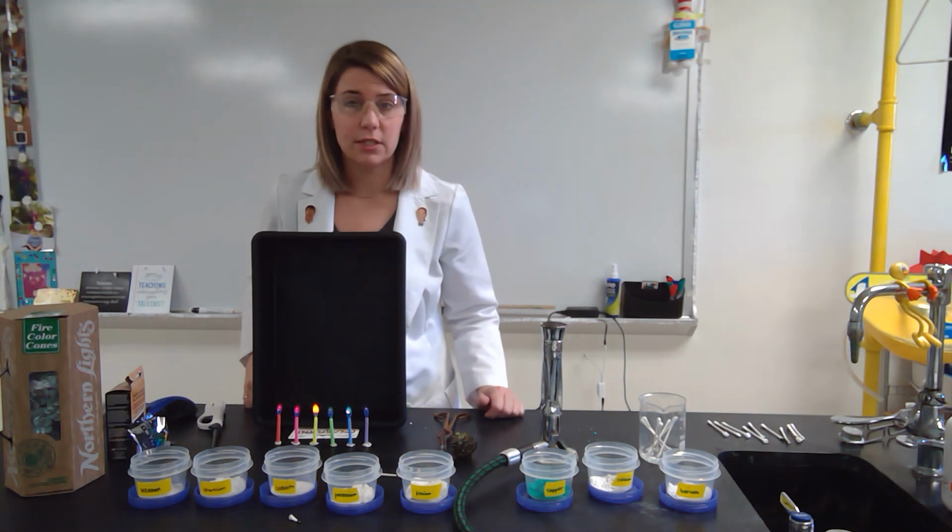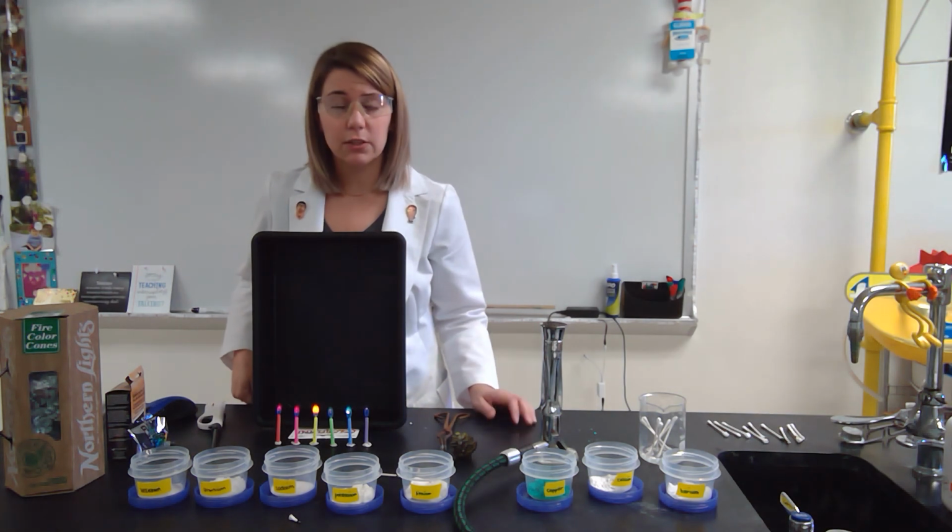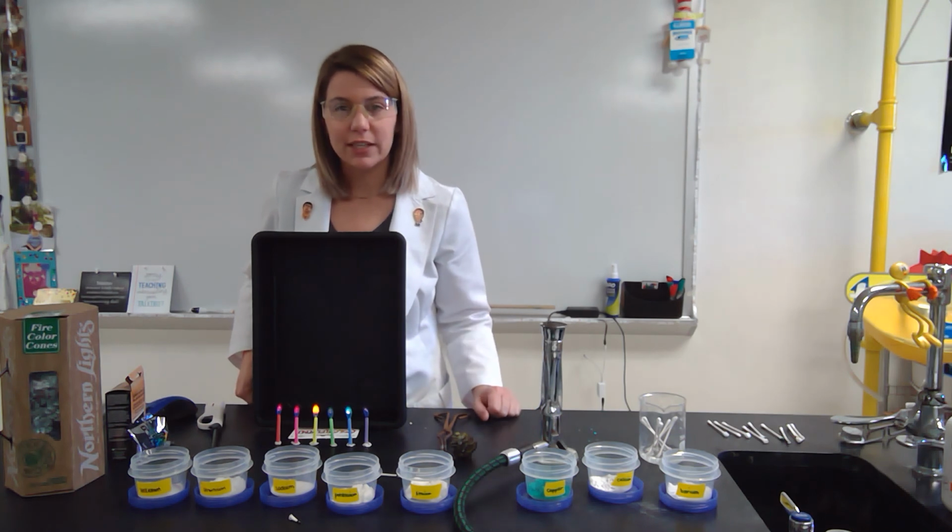So here are some applications of the Flame Test Lab, some things that maybe you've seen in real life, and I hope that you really enjoyed looking at the chemistry of these.